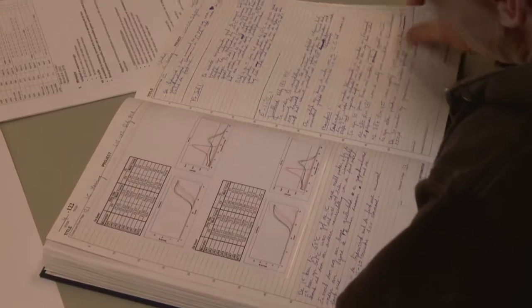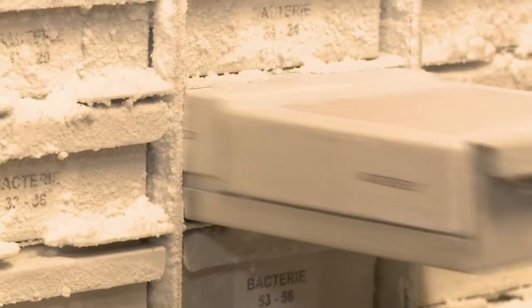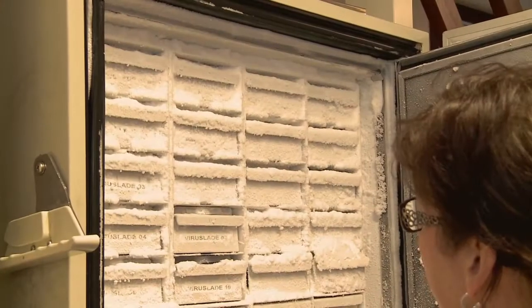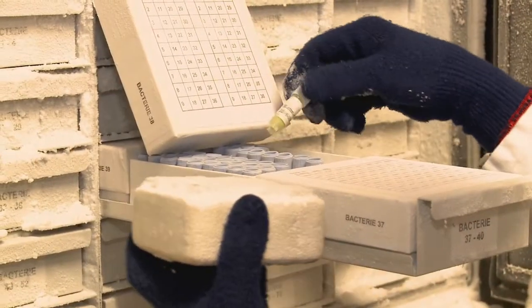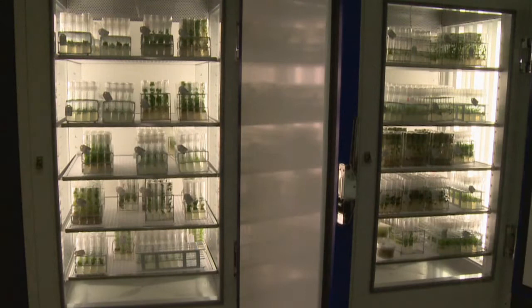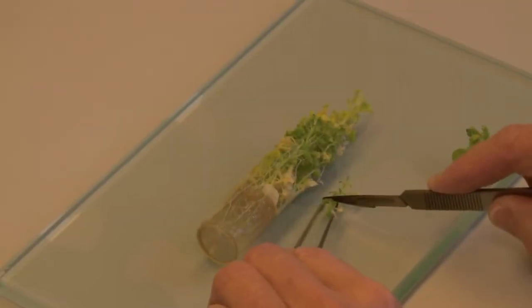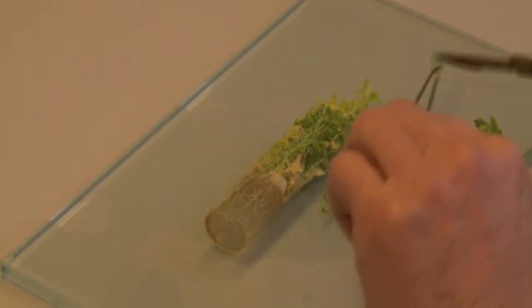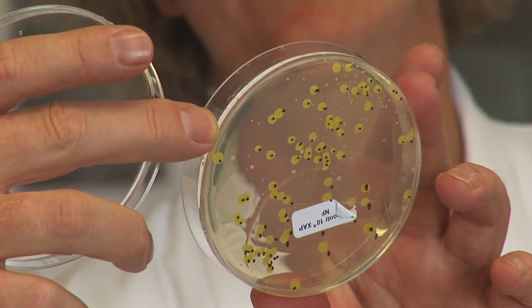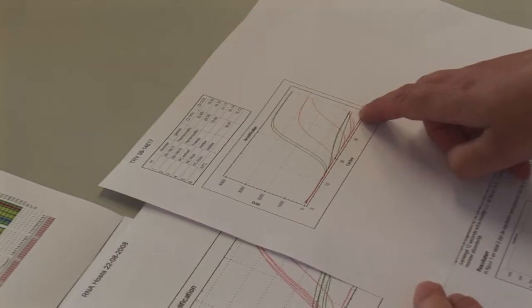When new tests are being developed, the pathogen collection of Naktuinbouw is used. This collection contains pathogens that were once isolated from infected plant material. Naktuinbouw also has a unique collection of plants infected with particular viruses. These collections are essential in the development of new tests. The collections are also used for the validation of the test protocols. In other words, to determine whether a test meets its specifications.